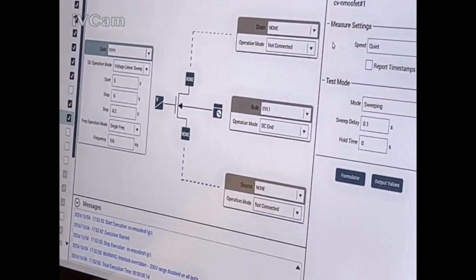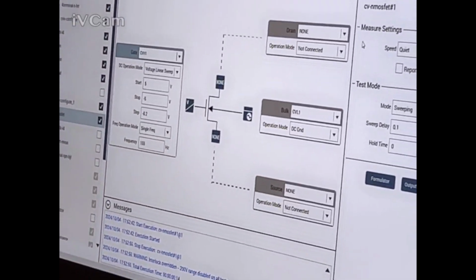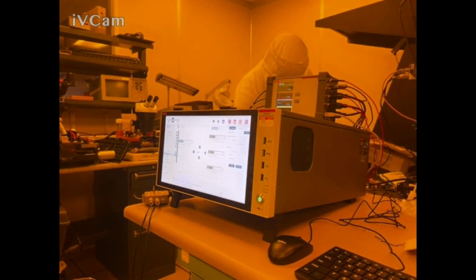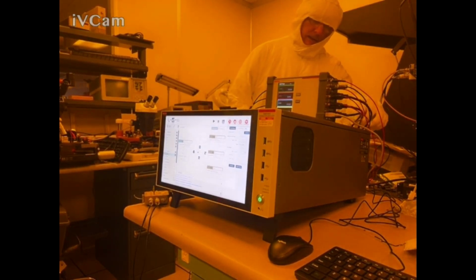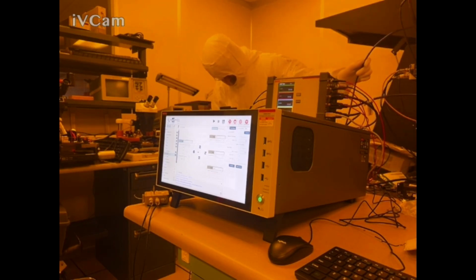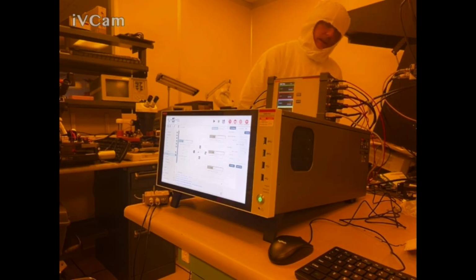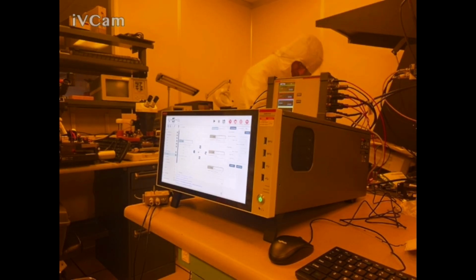What is the problem here? Channel 1? Who's this guy? It's gotta be right, because it worked on the DC stuff. Channel 2? Who's this guy? Yep, channel 3 is yellow. Channel 4 is a feed through. I'm confused.